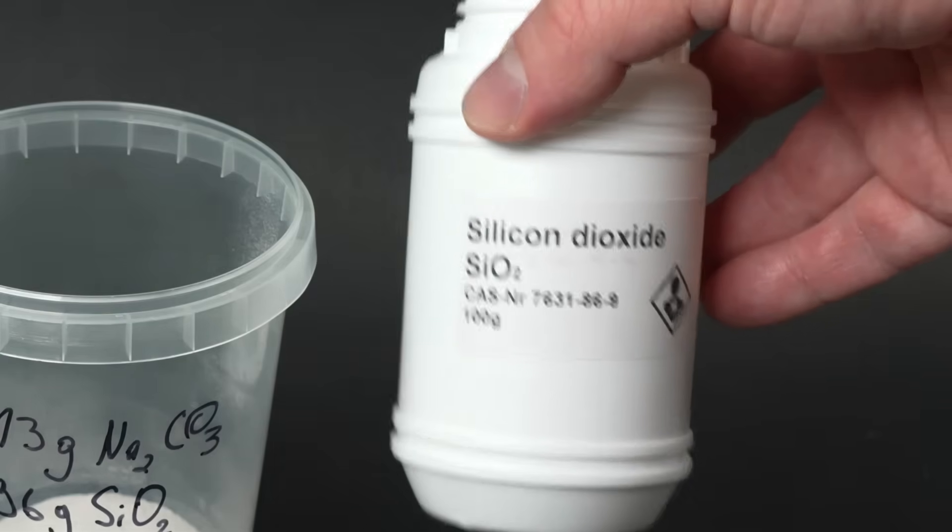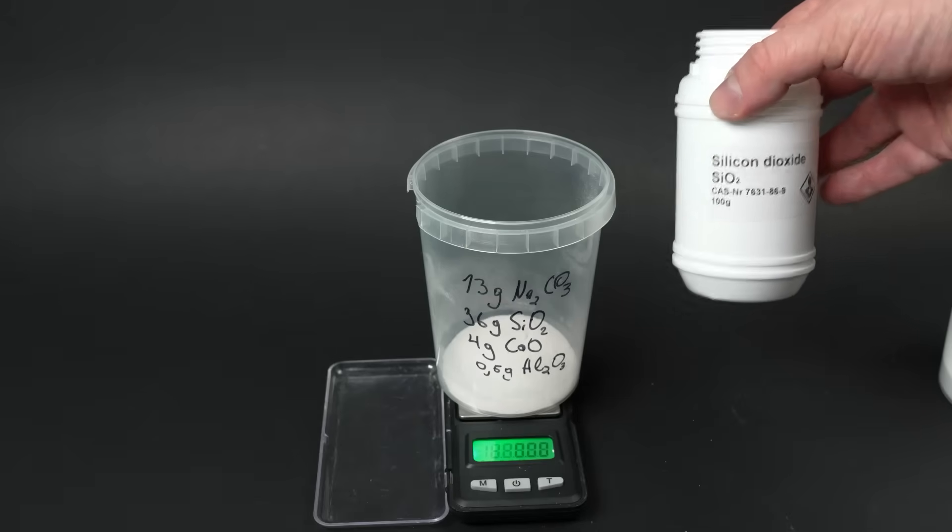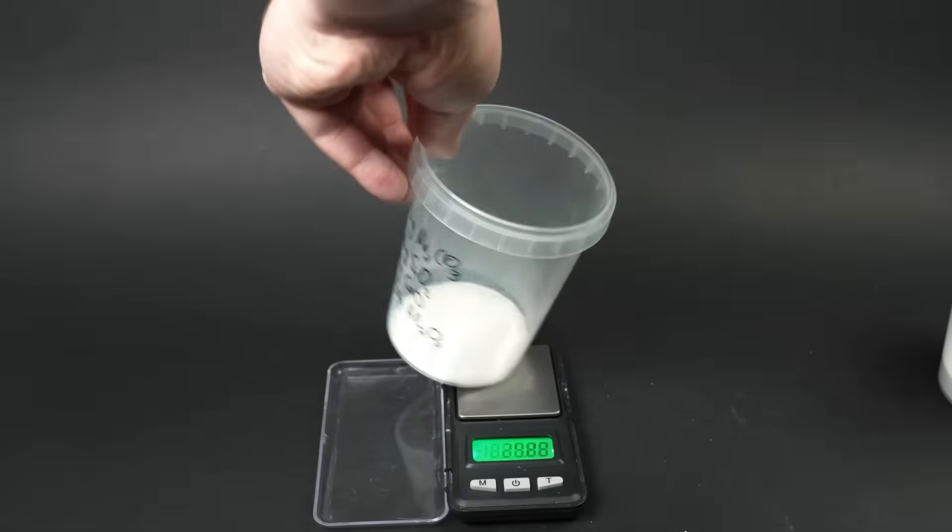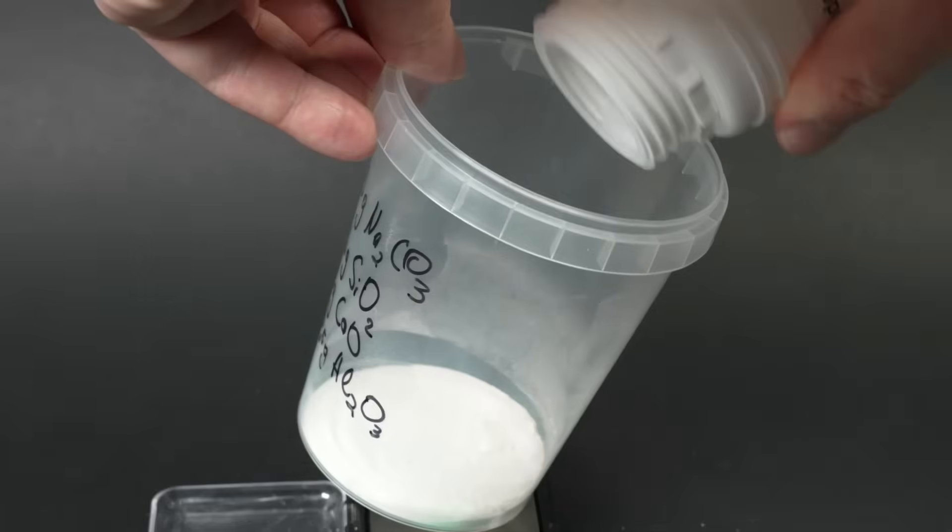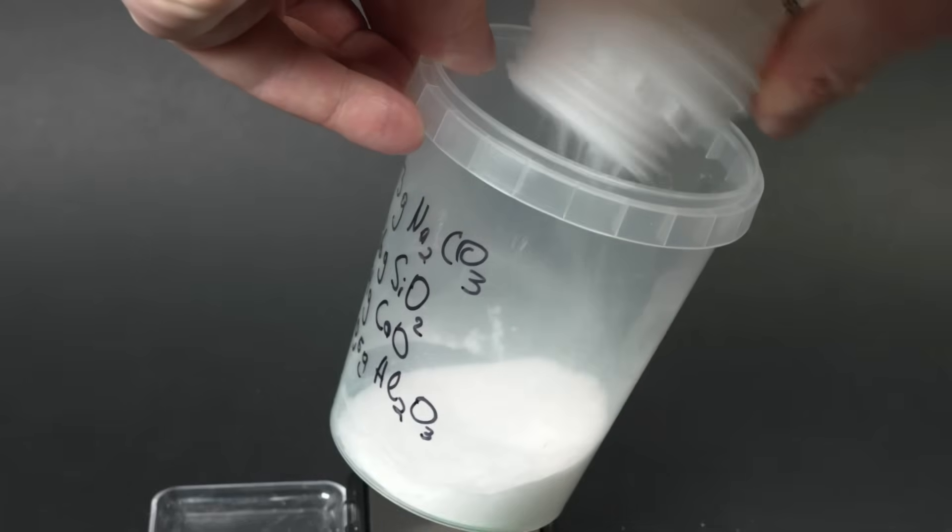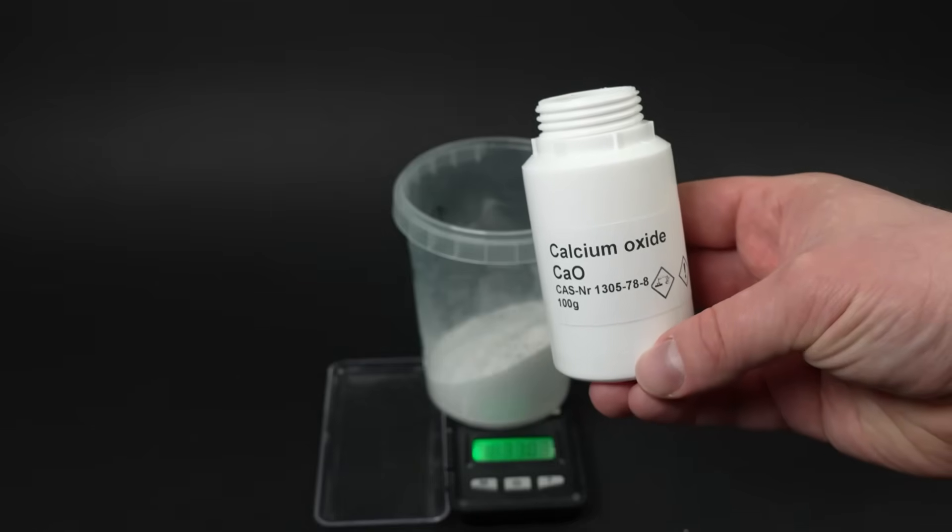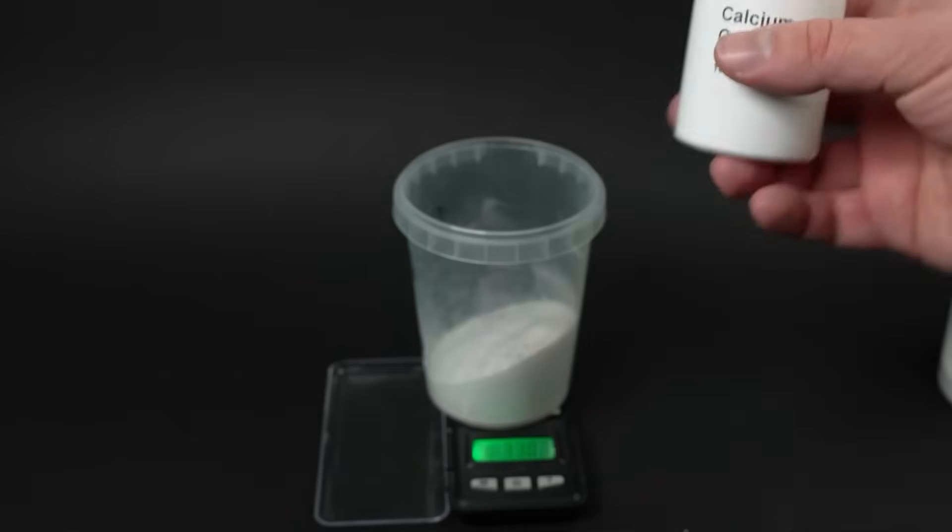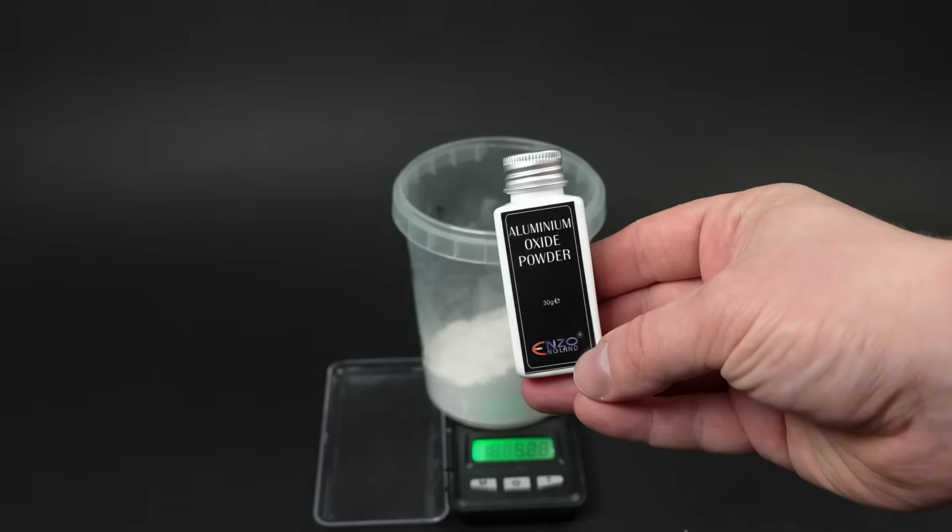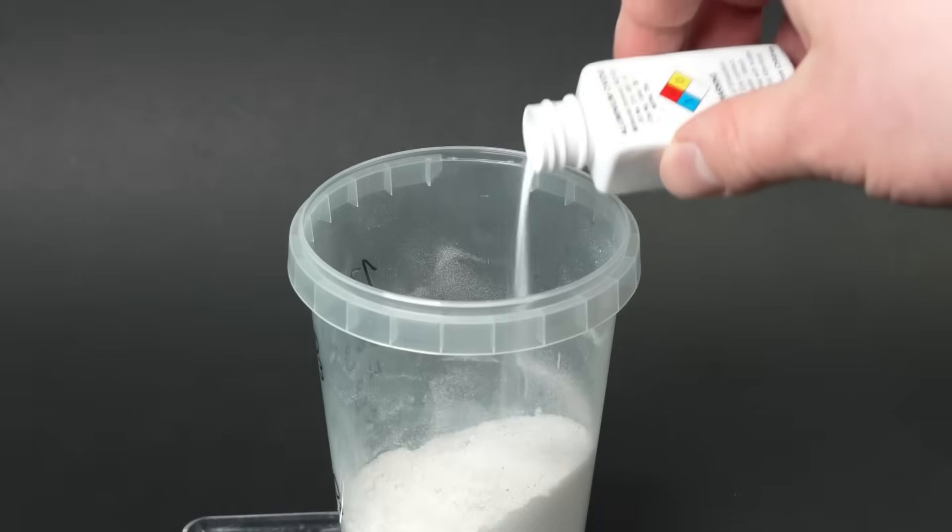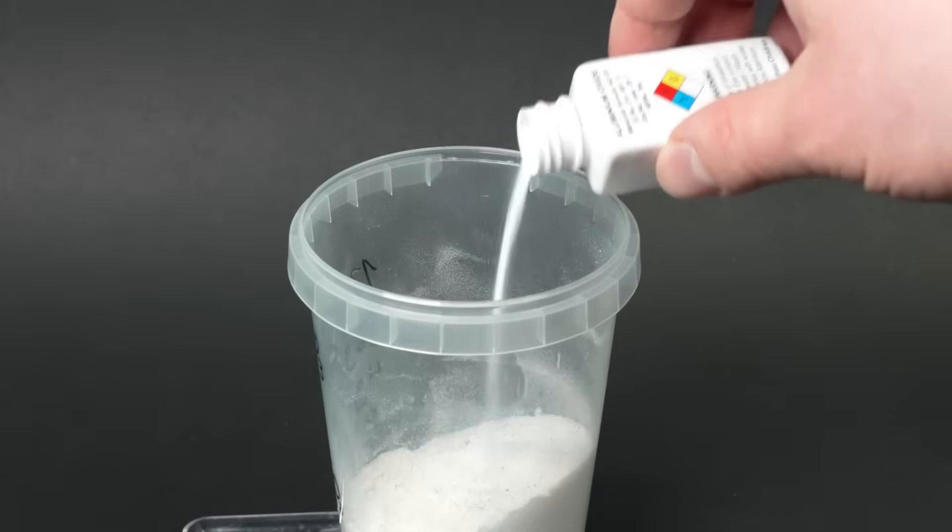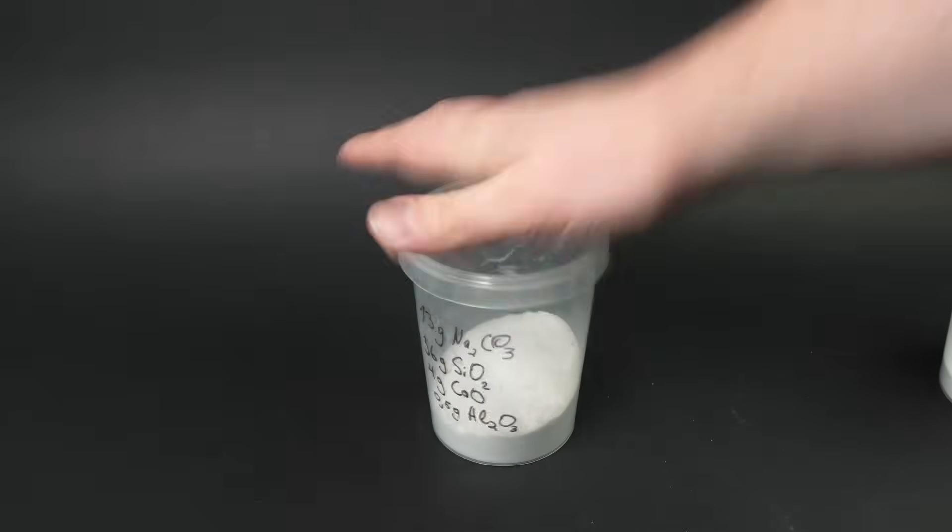As a result, the total mass together with the beaker was about 315 grams. Now it is necessary to heat the contents of the beaker to 300 degrees Celsius, so that the baking soda or sodium bicarbonate begins to decompose into sodium carbonate and carbon dioxide. After another 30 minutes of cooling, I weigh the beaker again, which has become lighter by as much as 40 grams. This indicates that almost all of the sodium bicarbonate has converted into carbonate, and I now have pure soda in the beaker for making soda glass. Now all that's left is to weigh out the necessary substances in specific amounts to create the batch, or the material for melting the glass mass.